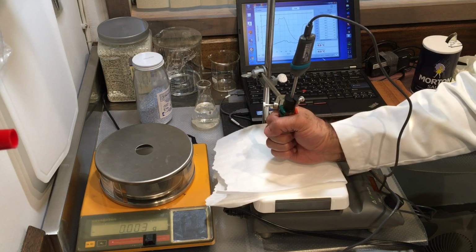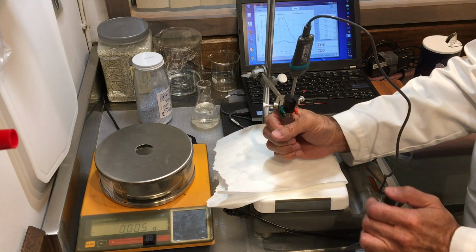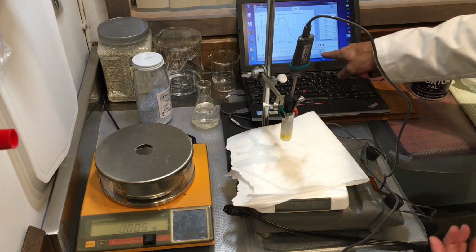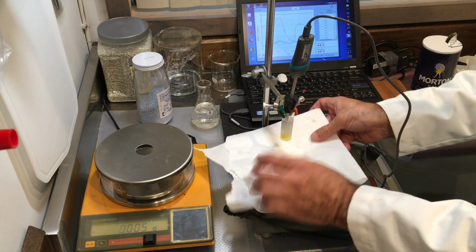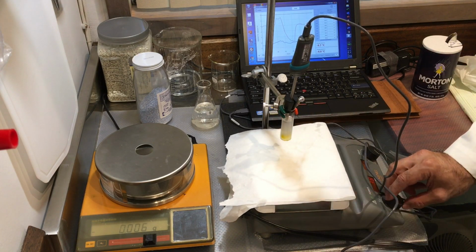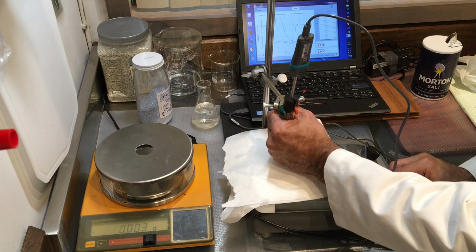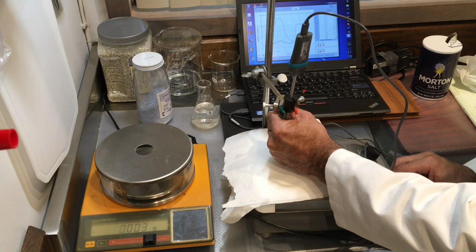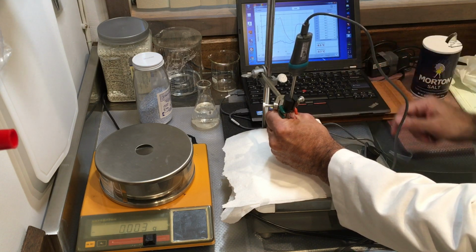So I'm going to melt this a little bit because we want to see, even though it's outside at room temperature, the temperature is still -4 degrees Celsius. So I'm going to get the stirrer going. It's trying to get loose. I'm going to warm it with my hand. The temperature is starting to rise, -3.7.